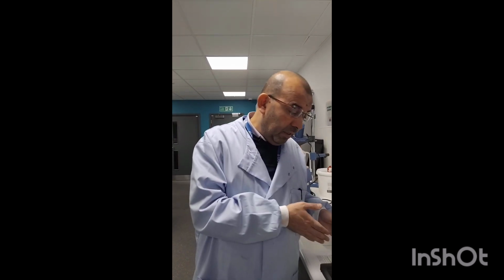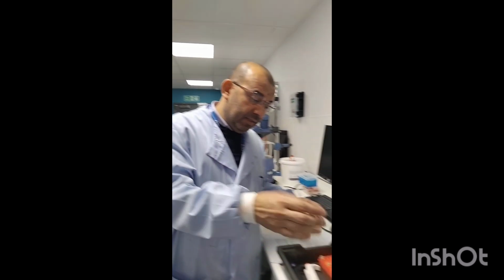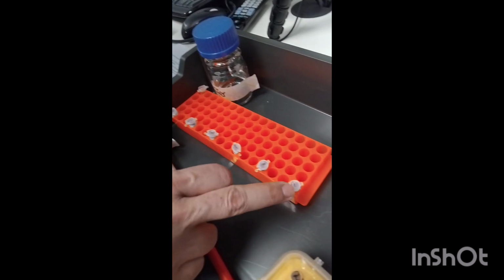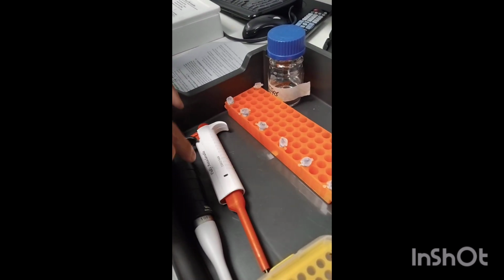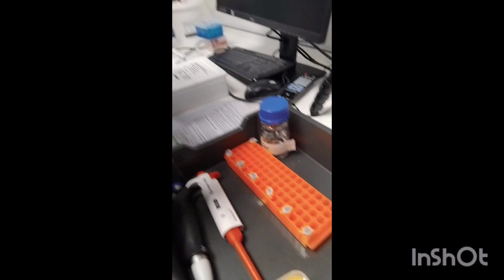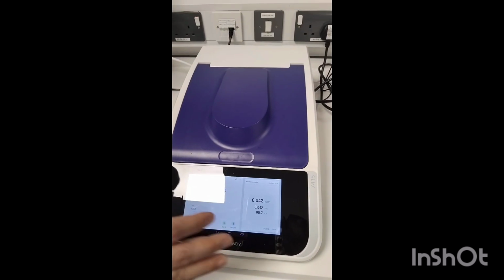In this second part, we'll repeat the same procedures, but using different concentrations. Instead of using 100 millimolar, we'll start now with the smallest one, 5 millimolar. Do the same procedures: buffer, then the substrate, this time not 100 millimolar but 5 millimolar, mixing them, blank them in the spectrophotometer, then add the same amount of the enzyme, 25 microliter, to the new substrate, which is 5 millimolar. Then determine the absorbance every 15 seconds as we did with the 100 millimolar.